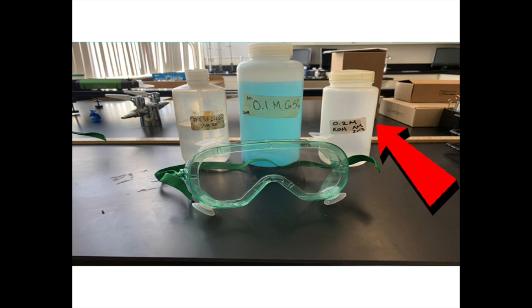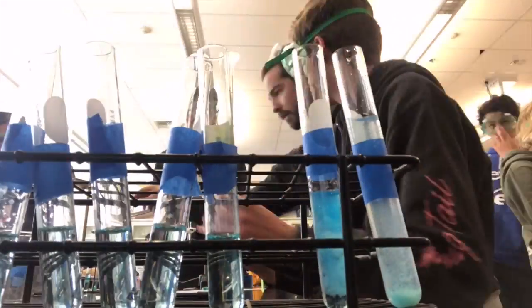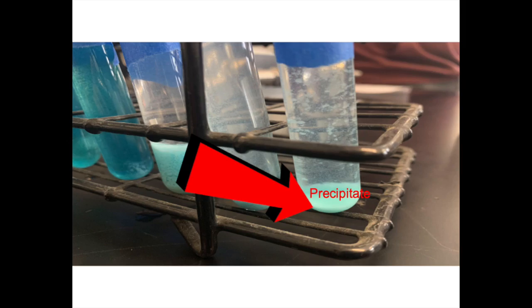Before the chemical reaction took place, the potassium hydroxide was a clear liquid and the copper 2 sulfate was a blue liquid. But after the reaction took place, a light blue precipitate started to form at the bottom of the tubes and the supernatant started to form on the top. A precipitate is a creation of a solid from a solution, and a supernatant is a liquid above the precipitate.